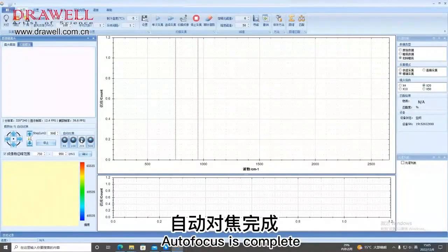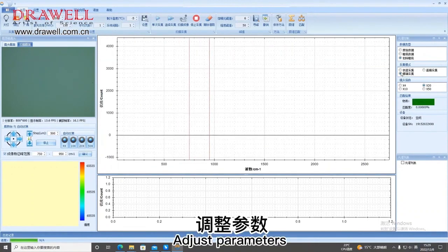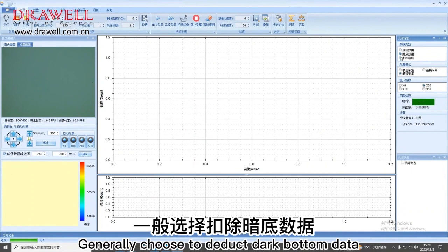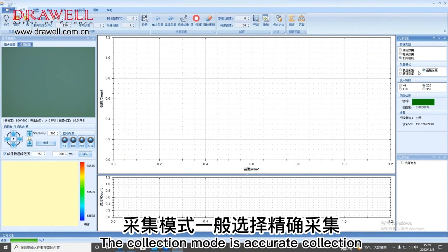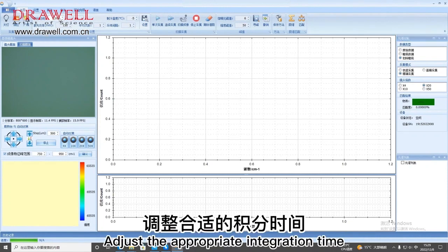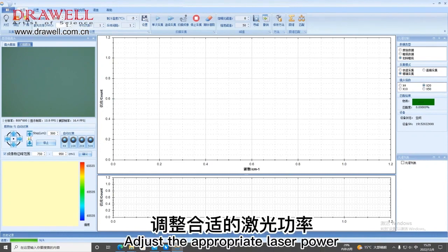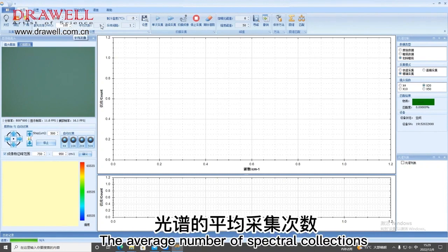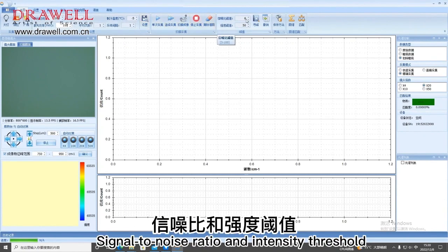Autofocus is complete. Adjust parameters. Select the data type. Generally choose to deduct dark background data. The collection mode is accurate collection. Adjust the appropriate integration time. Adjust the appropriate laser power. The average number of spectral collections, continuous collection interval, temperature of refrigeration, signal-to-noise ratio and intensity threshold, modify as needed.